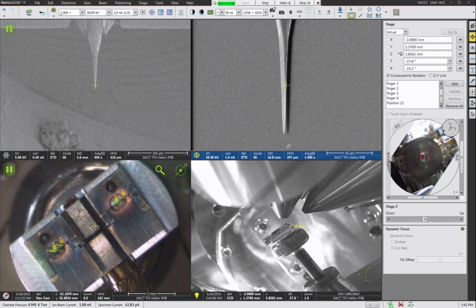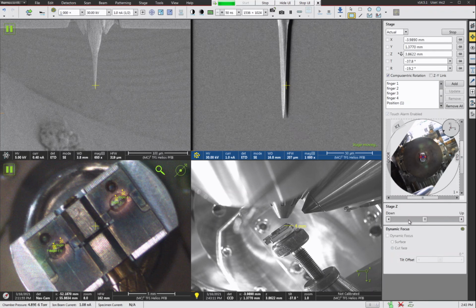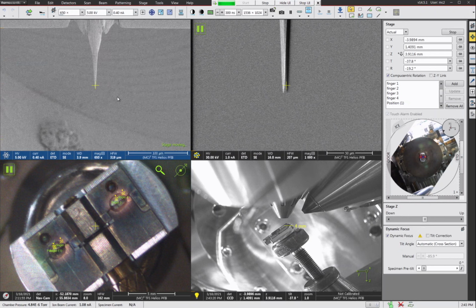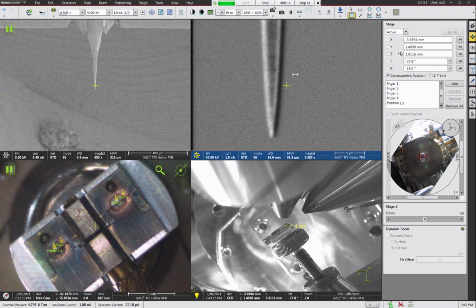Now, if I need to move that tip from where it is to the center of the image, keep in mind this Z-axis is the height control. So I would use the stage Z, and I would raise or lower the sample, and that will cause the sample to move the way that you're expecting it to, so that you can look at the end of the tip. The SEM image motion will be normal. So on the SEM image, go ahead and double click to move to whatever you need, but just be careful about the FIB image. Don't double click when you're looking at it like this, because more than likely you're going to crash.